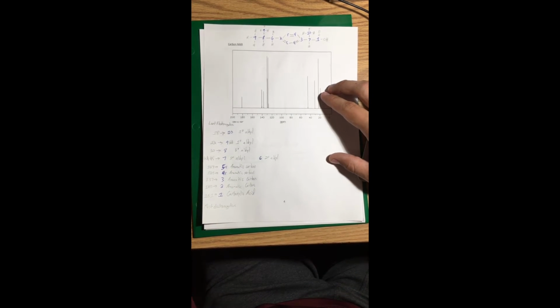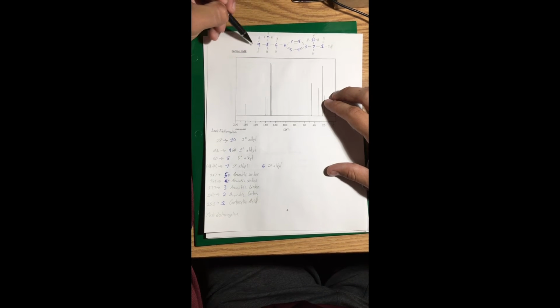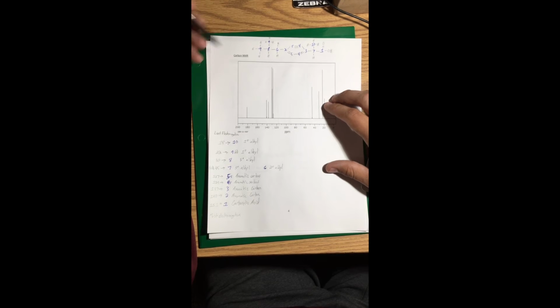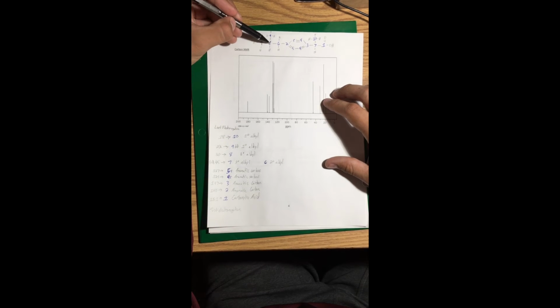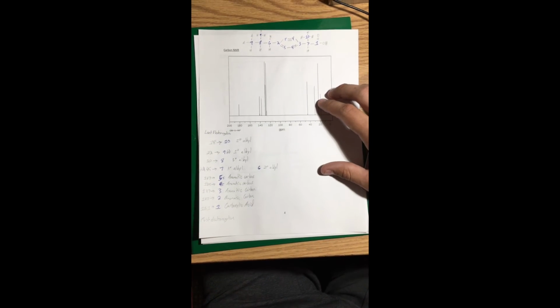Next down, move to the 22 parts per million. Large line here. It's also a primary alkyl. And there's 2 of them on this. One over here and one over here, because it's farthest away from the most electronegative atom. Next is to move to 30, which is actually a tertiary alkyl. As you can see right here, it's attached to 3 carbons and 1 hydrogen, making it tertiary.